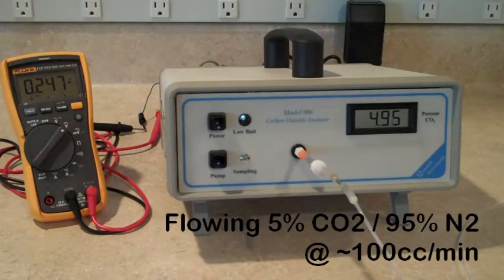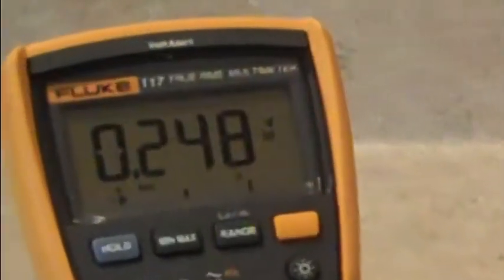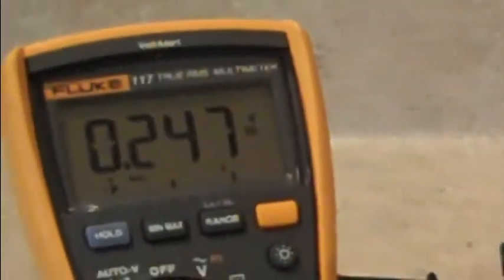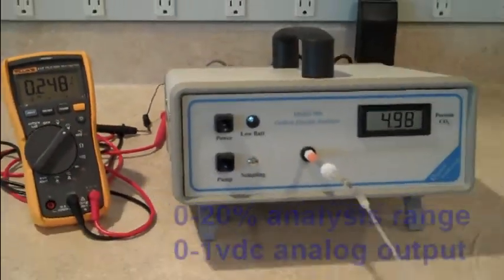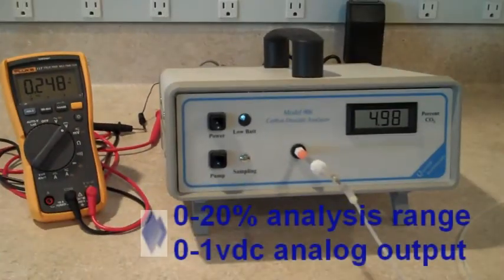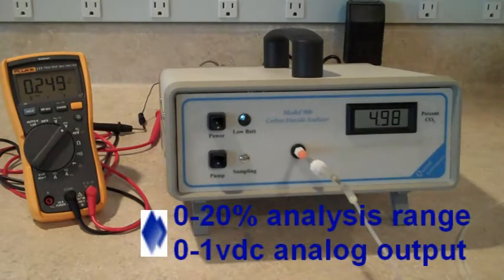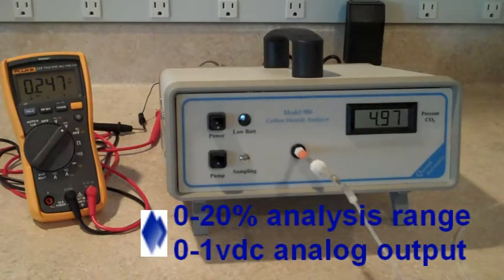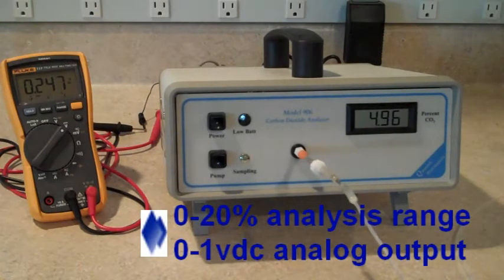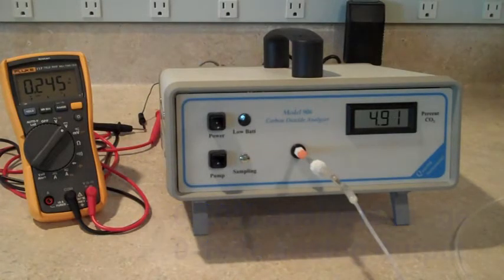And as you can see on the left, the voltmeter is reading about 250 millivolts, because for this particular analyzer, the analysis range is 0 to 20% and 0 to 1 VDC in linear relationship with each other.